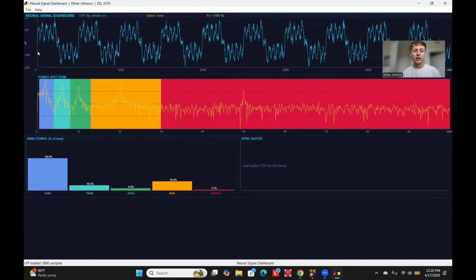Once we do that, it will plot the raw neural signal here. So this is the voltage time series. We have time and then the voltage, and we can see that signal here. Then down here, we compute the Fourier transform, and now we have frequency on the x-axis and then the strength of that frequency. Each of these different colors represents a frequency band, which are associated with different cognitive states and are implicated in different ways in disease.